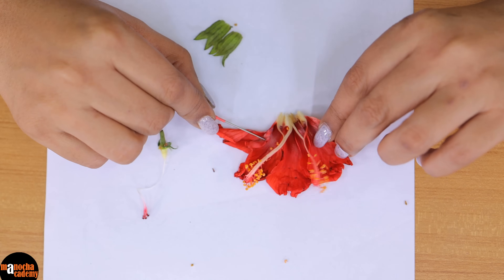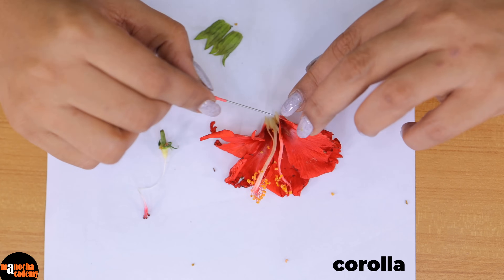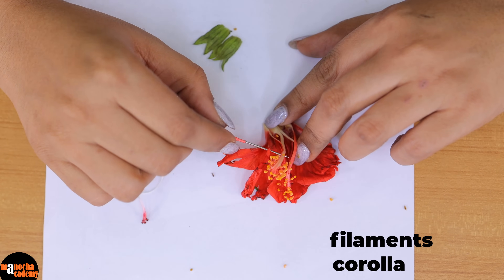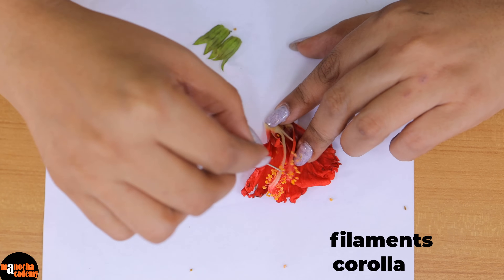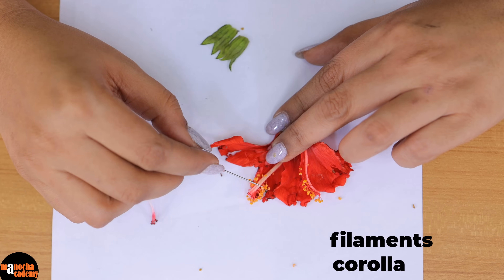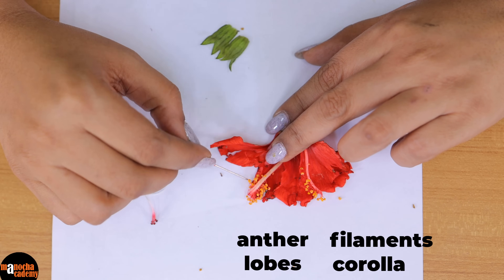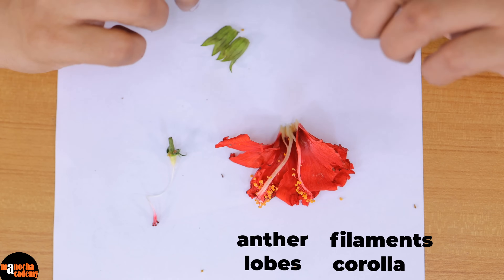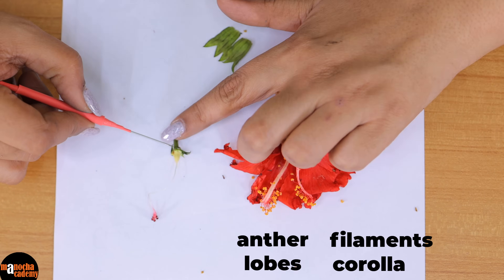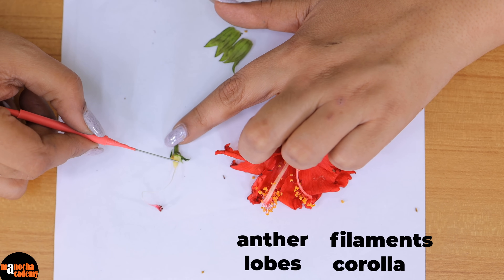On this side you have five petals forming the whorl which is called the corolla, and to that you have the filaments attached forming a tube. The tube has been dissected so that we could take out the style, and at the tip of the tube you can see there are numerous anthers present. Now we will look at one of these anthers and the cross section of the ovary to see what is present inside.